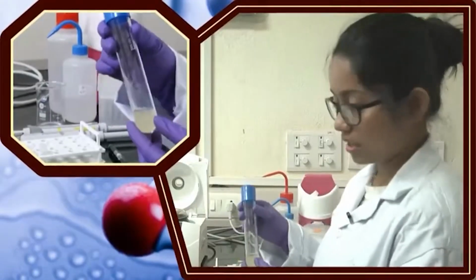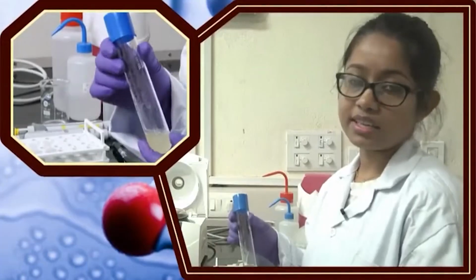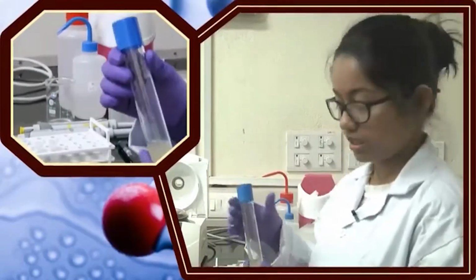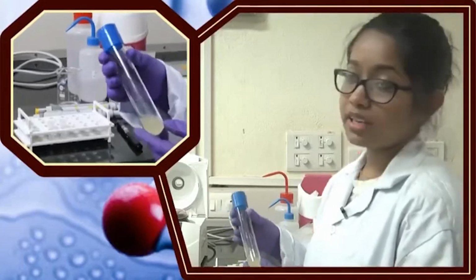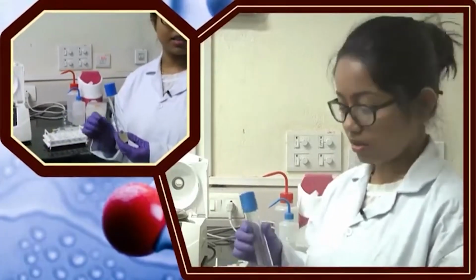And also the LB media has a particular selectable marker, the antibiotic. In my case, the bacteria contains a pET28 vector. The pET28 vector has a kanamycin resistant gene which is expressed when it grows, so I have put kanamycin in my media. Other vectors like pET3a have an ampicillin marker gene, so you have to put ampicillin. So, depending on the vector or the plasmid you are using, you have to check what kind of antibiotic resistant gene it contains, and accordingly you have to add that particular antibiotic to your media.